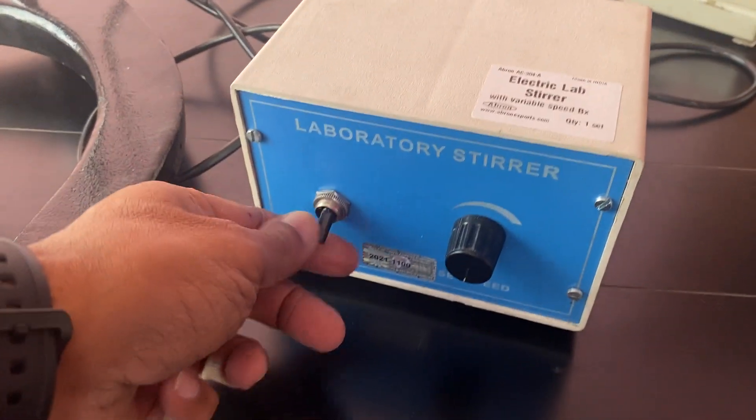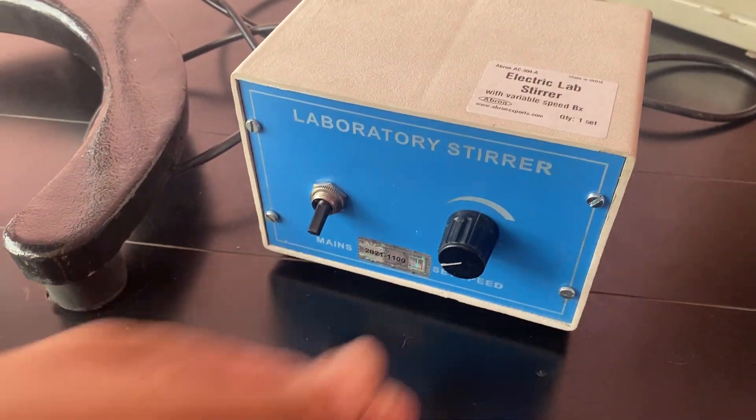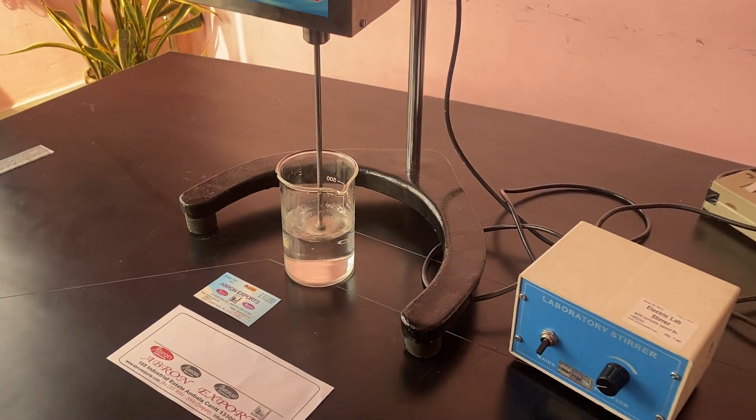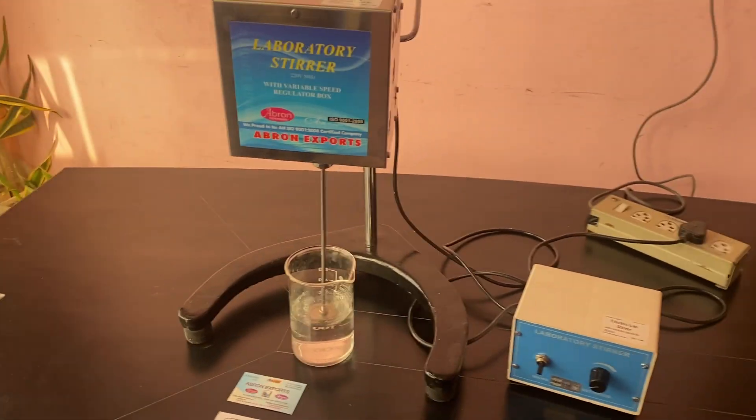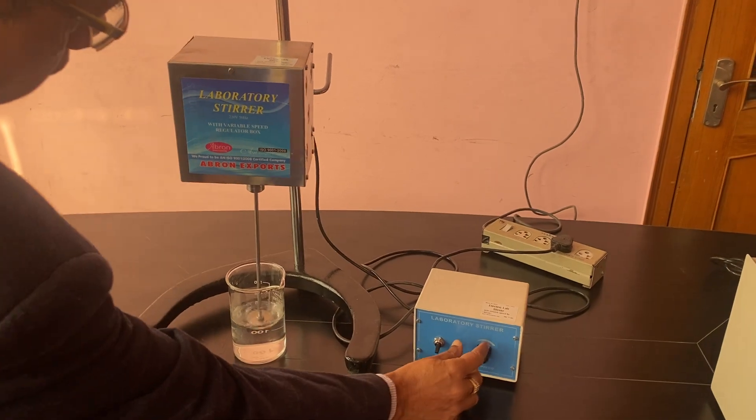Switch on, then you start it. It starts working, very easy to use. You keep on increasing the speed.